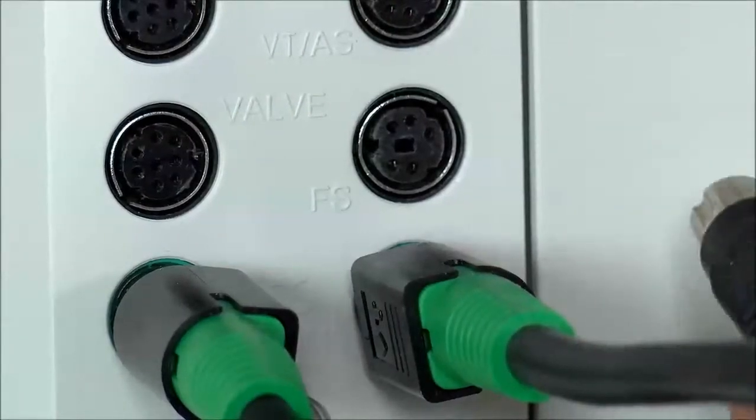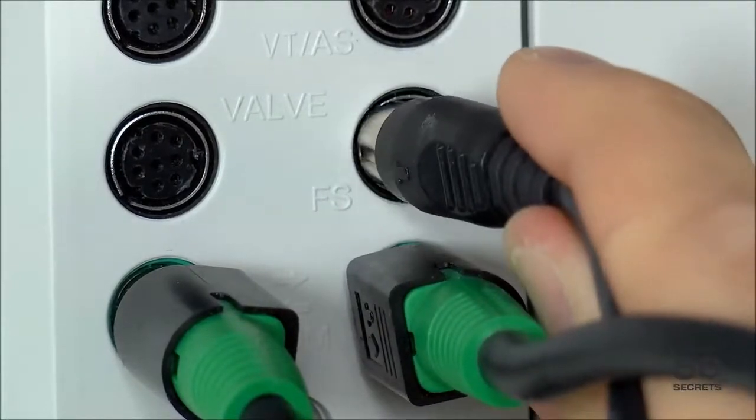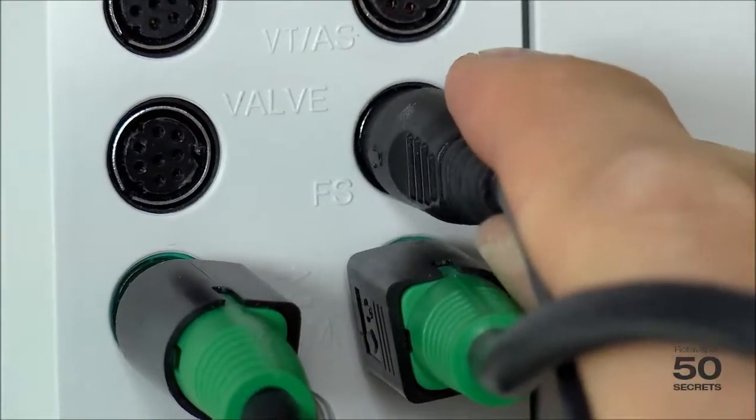Last but not least, you plug in the foam sensor into this area where it says FS for foam sensor.